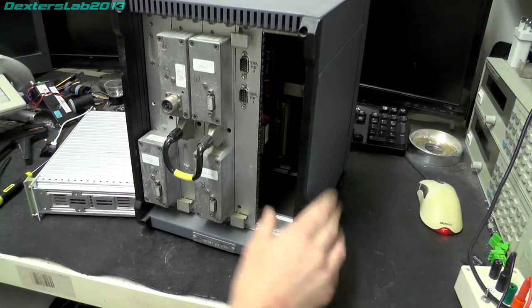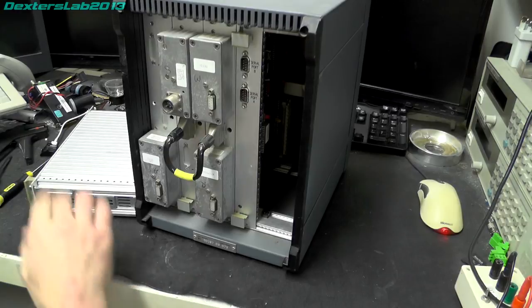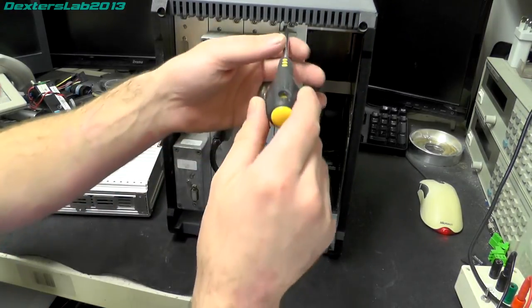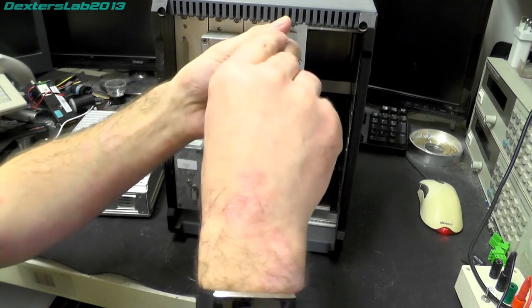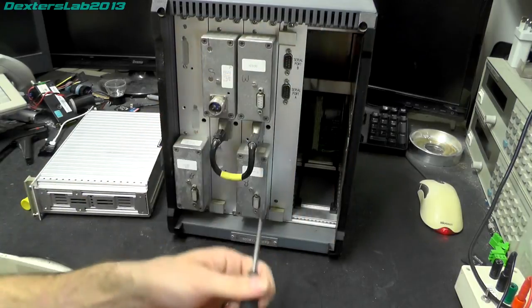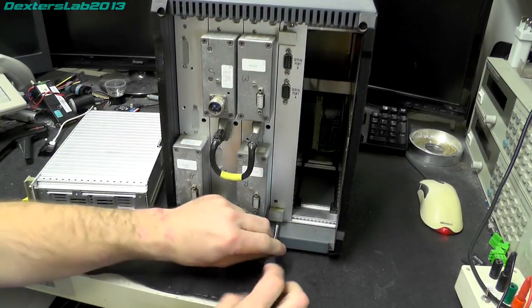So yes, inside there, I can't really see much in the back there. It looks like there's a backplane these modules are going to plug into. So let's go for the serial port. What we'll do is take all these cards out together, get the box out of the way, and then have a look at them in a bit more detail.